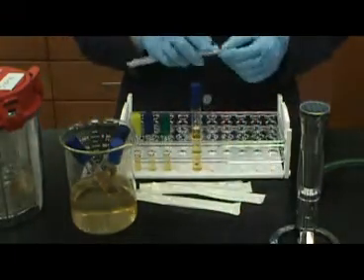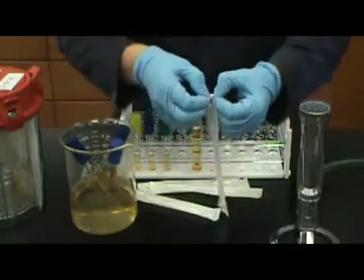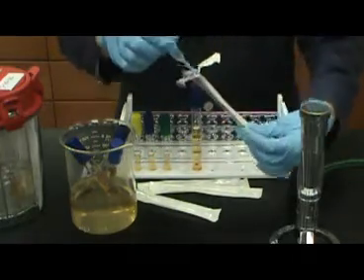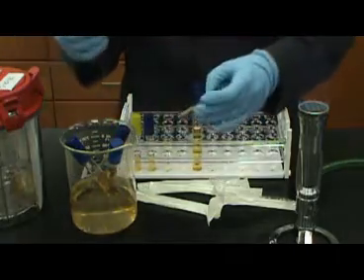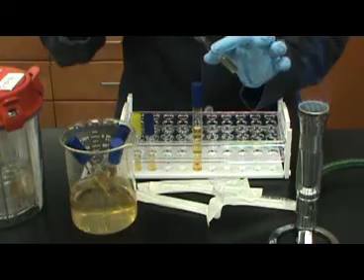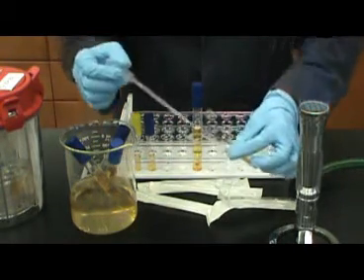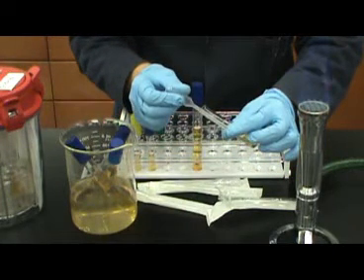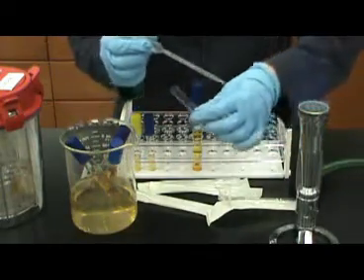The agar used for the aerotolerance test is BHI agar, which stands for Brain Heart Infusion Agar. This is an enriched media that promotes the growth of anaerobic bacteria. Inoculation of the BHI can be a little bit tricky. You are inoculating the agar with a liquid culture. However, you do not want to introduce air bubbles or oxygen into the media, since we are trying to grow organisms in anaerobic conditions.